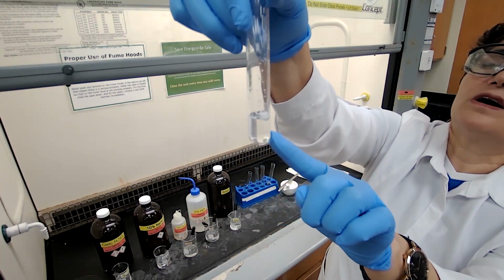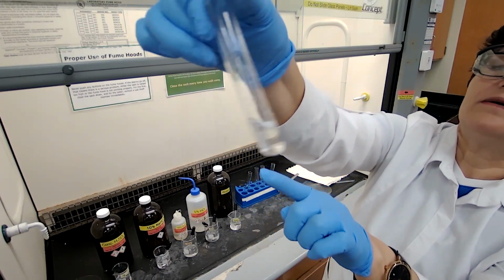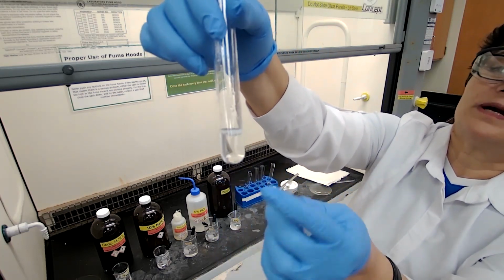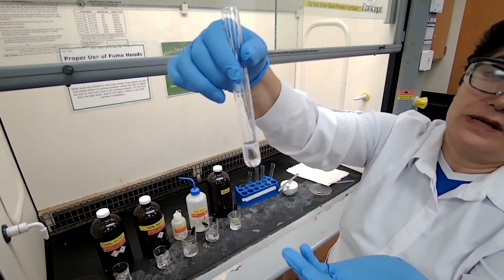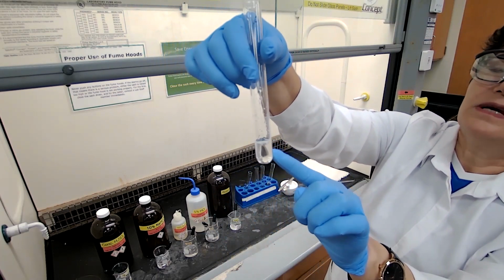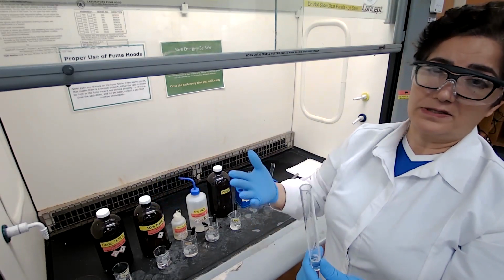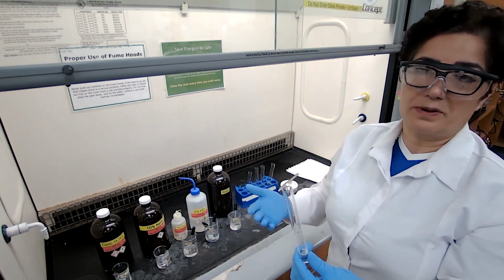If I wait long enough, it's going to disappear. But even if your sample does not disappear and you see the bubbles forming at the surface, that means sodium bicarbonate is reacting with your unknown, and that means the unknown is carboxylic acid. If it's phenol, you will not see these bubbles, because it's soluble in sodium hydroxide but not in sodium bicarbonate. This is the characteristic for carboxylic acid. So I do have a conclusion at this point that the compound is carboxylic acid.